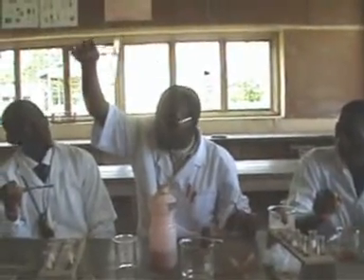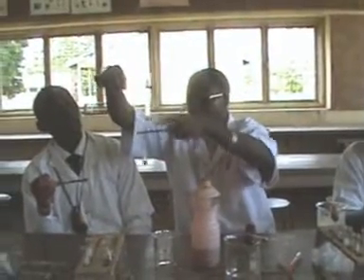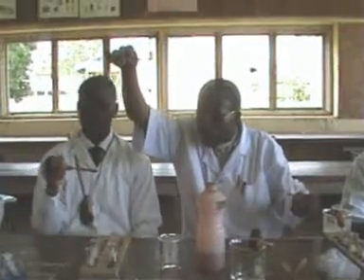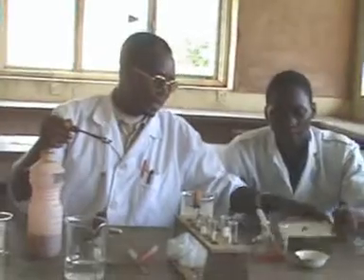You cannot speak louder. So here, from just adding the Millon's reagent, you already observe some brown precipitates settling down. But you first of all see a cloudy suspension, which is up here. This is cloudy, it looks like clouds. Yes, so on addition of Millon's reagent, a cloudy suspension is observed, and then on settling after some time, some brownish precipitates are found under. Okay.